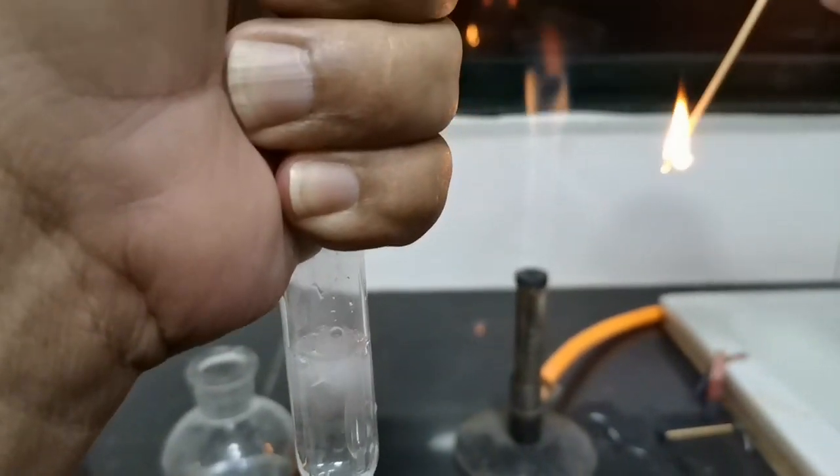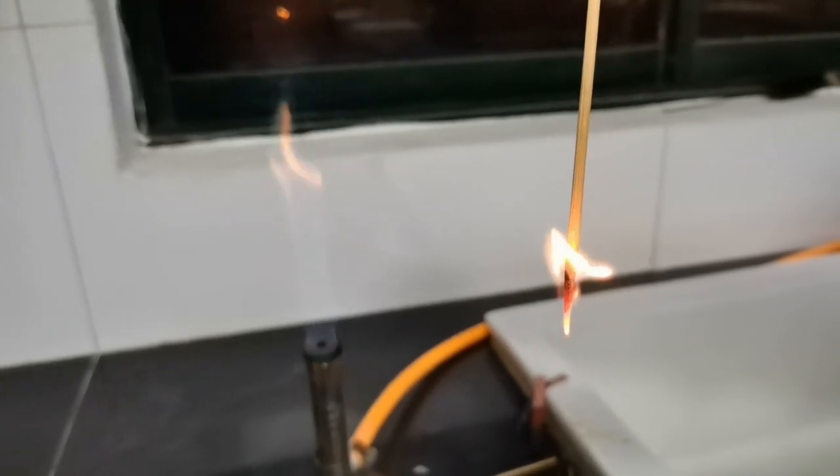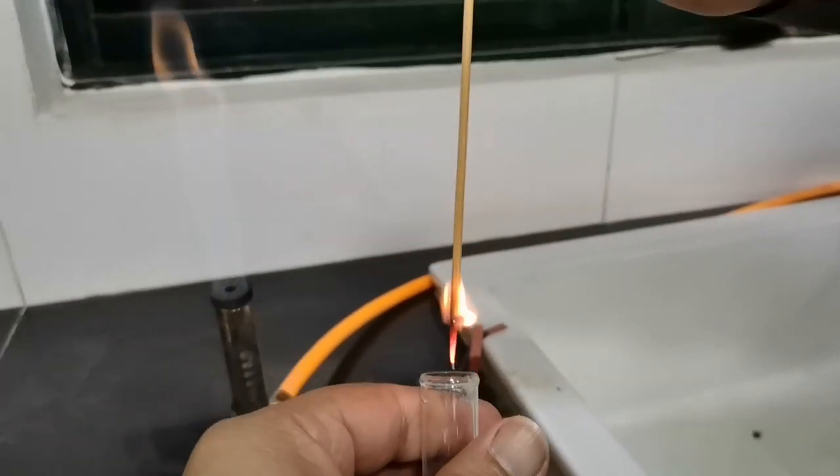Now we are going to test for the presence of hydrogen gas by exposing it to air along with a burning splint, and here we go. And that is the pop sound you needed to hear - this pop sound confirms the presence of hydrogen gas.